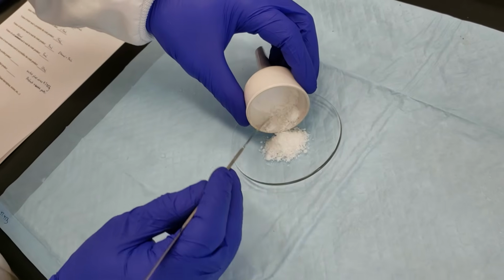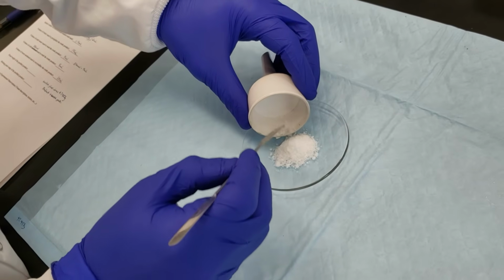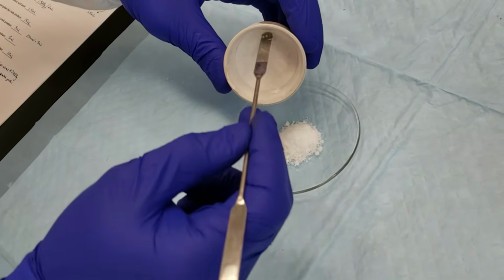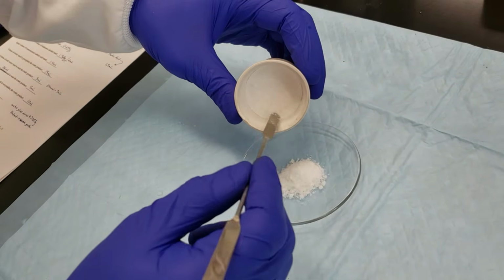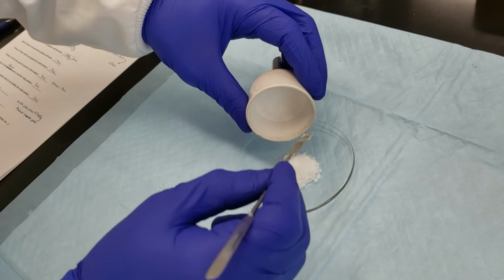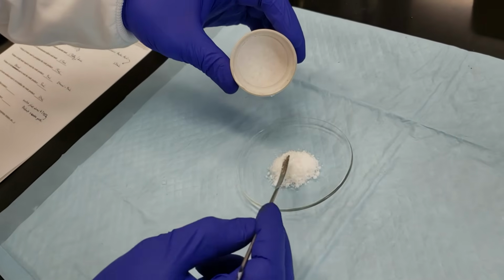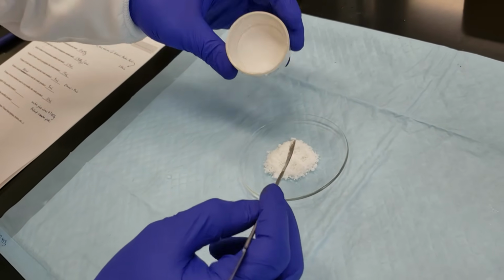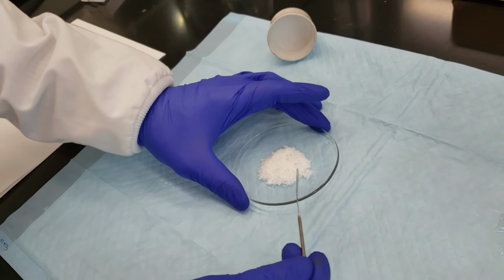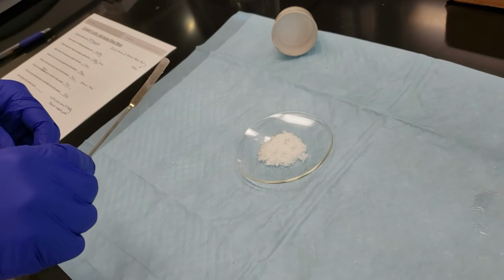We'll just get everything that we can off of our filter paper here. We don't want to leave anything behind if we can help it. Oops. Don't want to take my filter paper off if I can help it. All right. And that is basically everything that we had in our Buechner funnel. So we'll take these over to the drying oven and we'll let them dry for about 10 minutes at 60 degrees, and then we'll come back for the final weighing.